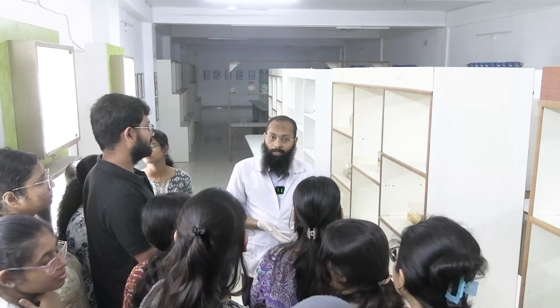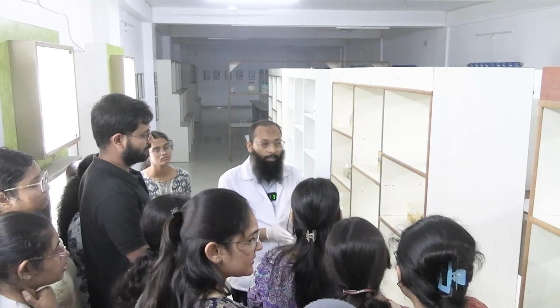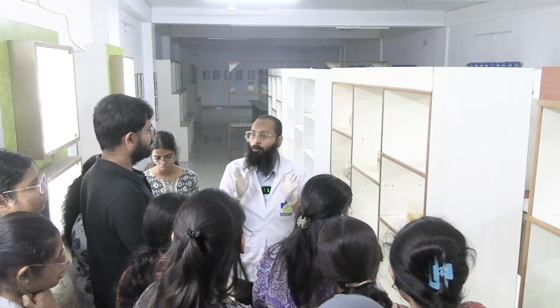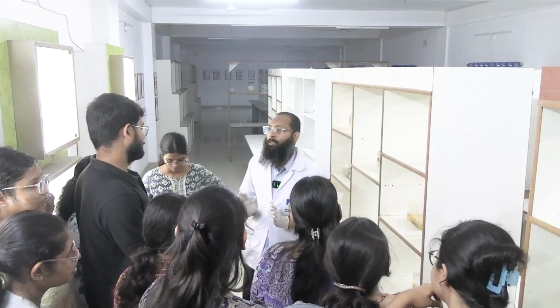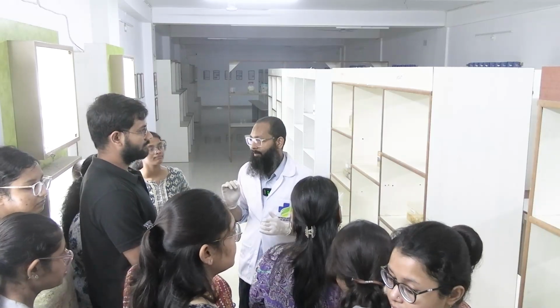Okay, clear? The time between cutting the tissue out from the patient's body and putting it in the formalin is called the cold ischemia time. This should be as minimum as possible. Ideally it should be less than half an hour, but at max you can go for 1 hour.